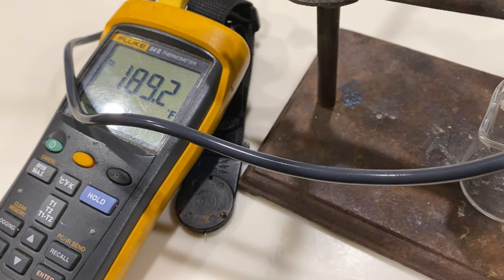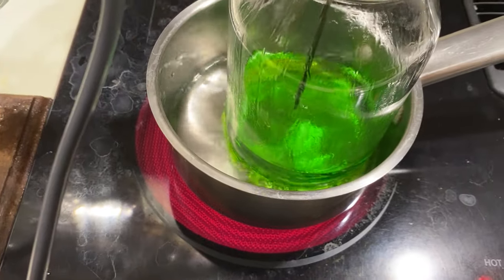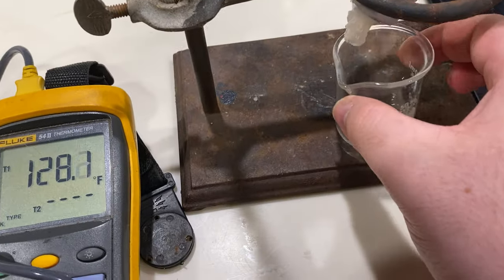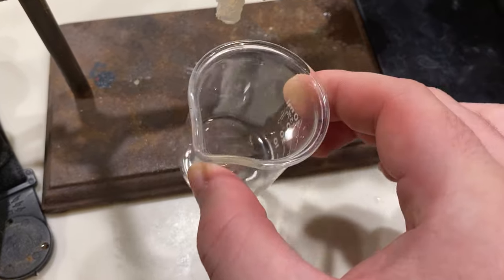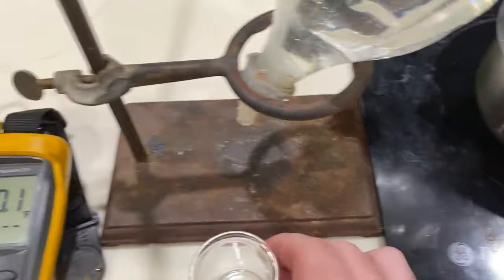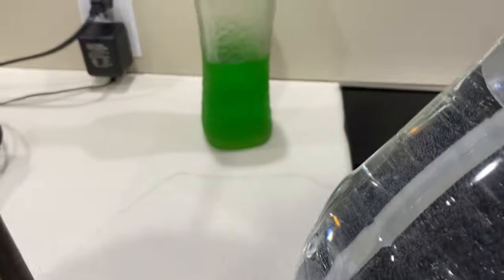Right there at 189°F. That means the ethanol in the green liquid is boiling, but the water is not. And this liquid that we have collected in this beaker over here is mostly alcohol. Of course, some water does get carried up with it.